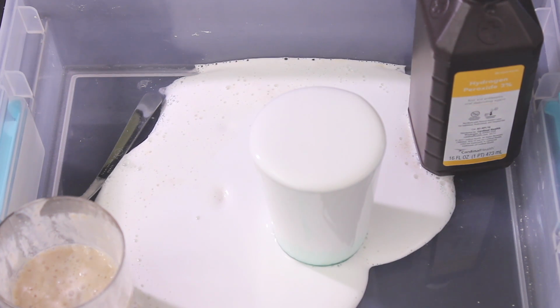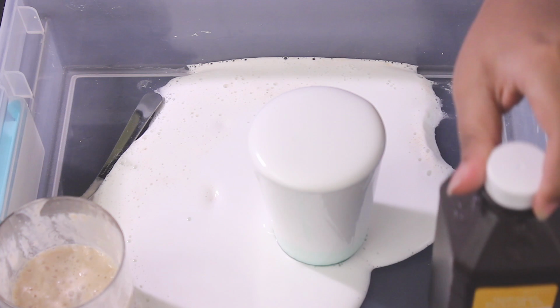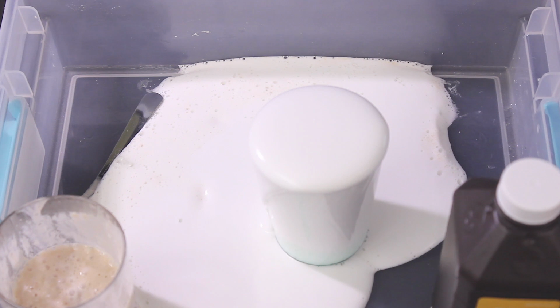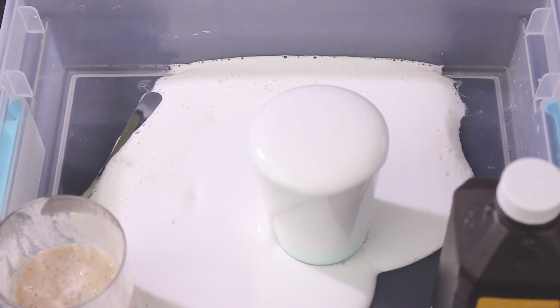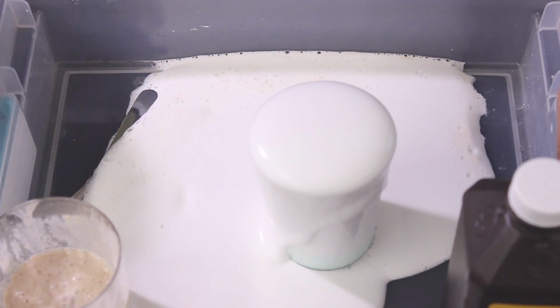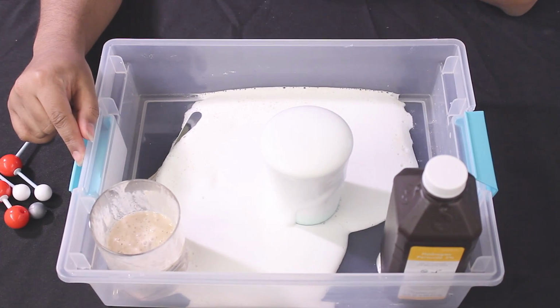I use 3% hydrogen peroxide. If you end up going to the beauty store or somewhere that's not CVS, you can find more highly concentrated hydrogen peroxide, which will make the bubbles go up even more. But the amount of bubbles we got from just a little bit of hydrogen peroxide and the yeast mixture is a lot, and it can be attributed to the oxygenation.